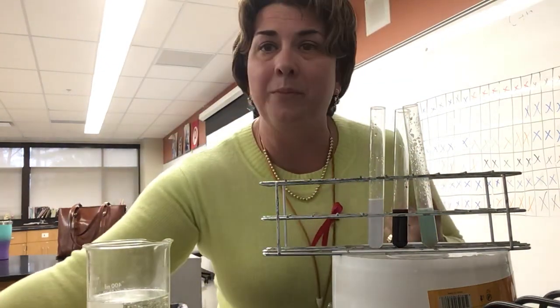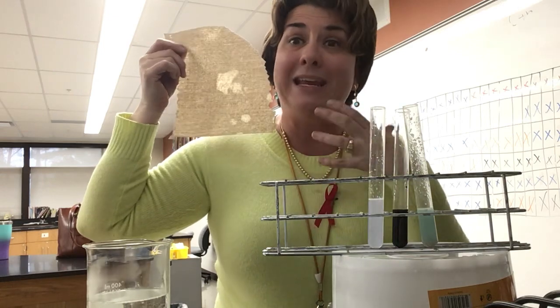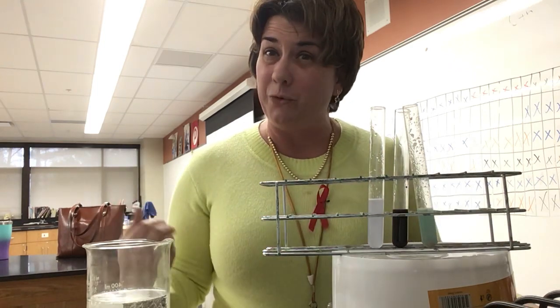And again, my brown bag test, we see that it is translucent on the brown paper, meaning it is positive for fats. So as you take a look at those receipts, please try to figure out which restaurant that would lead you to conclude.